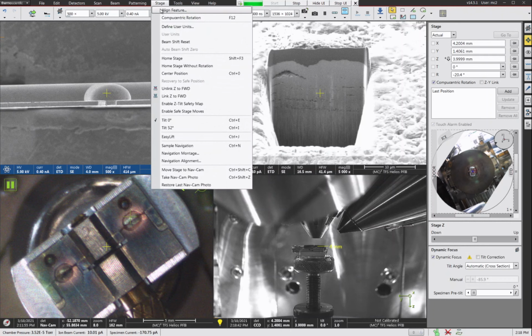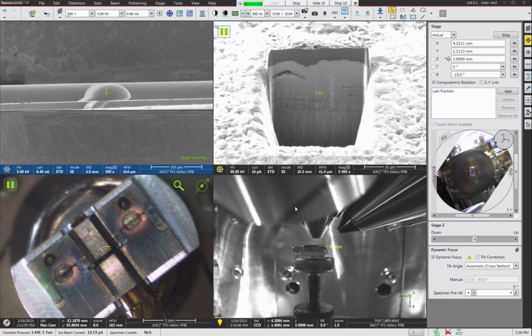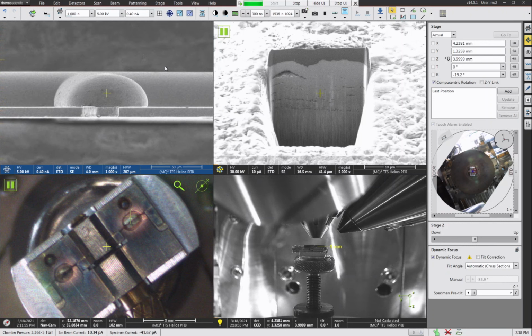Let's try that one more time. I don't think we got perfect there. Having a perfectly aligned grid for this isn't real critical because we're going to make a post. So it's symmetrical, doesn't really matter.